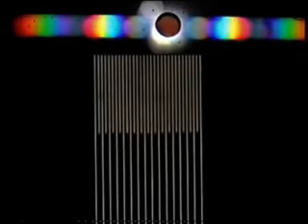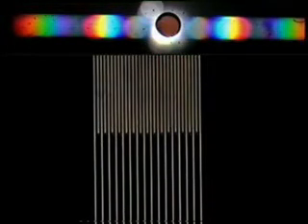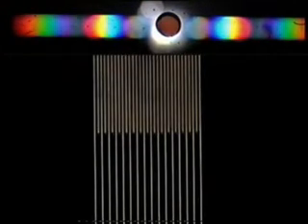So we have the diffracted beams giving us light in the positions of the lines. We have the zero order covering the full background. When we have both sets of light together, we end up with black lines. This is a dark field image.